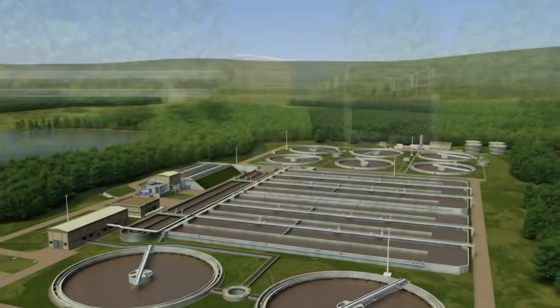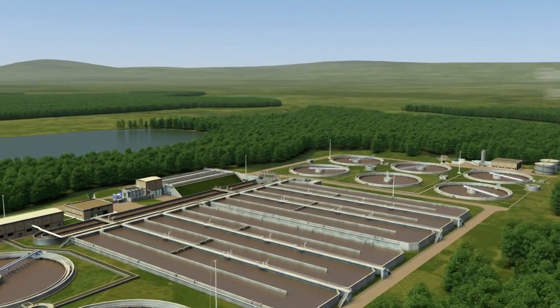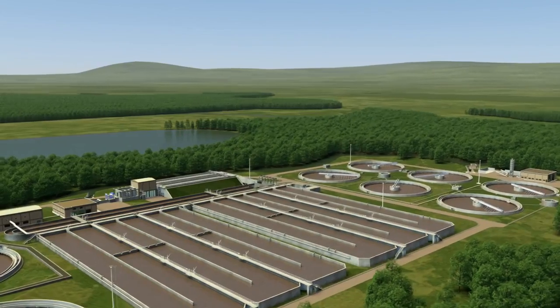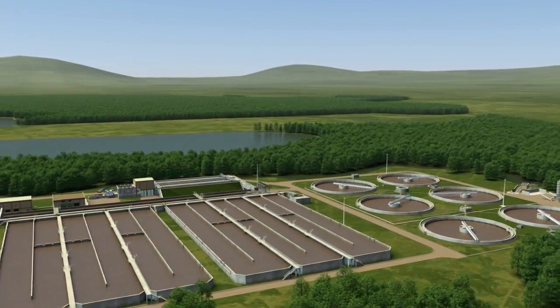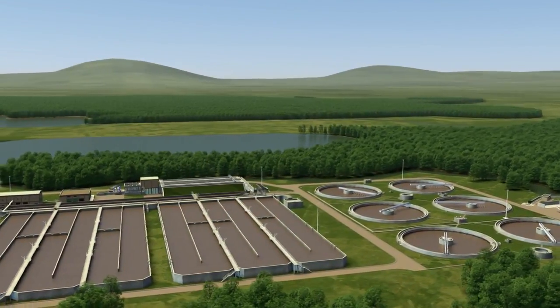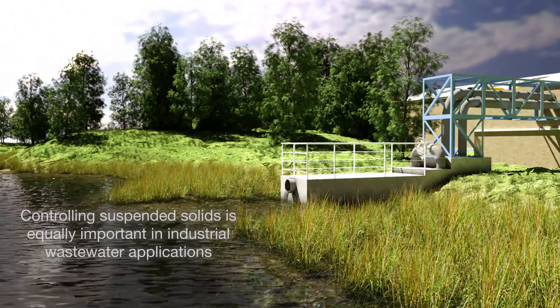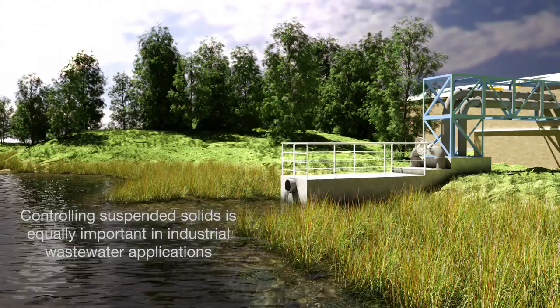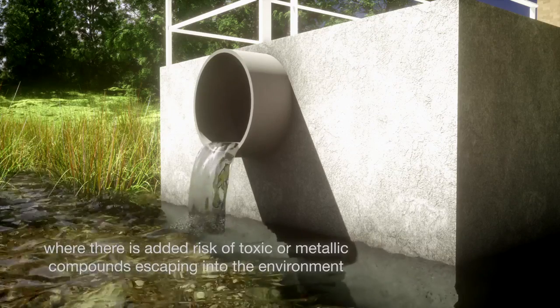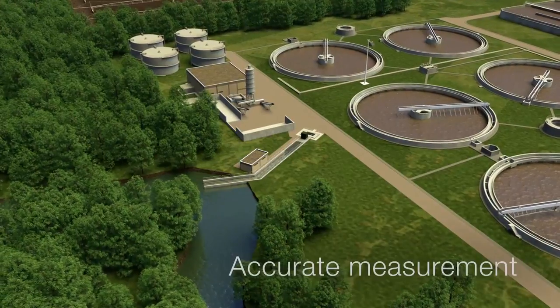Within the wastewater treatment plant itself, excess turbidity can be indicative of a poorly operating treatment process. It is important to address this issue as residual suspended solids breaking through from sewage digestion processes will continue to have a biological oxygen demand as they enter the receiving water. Controlling suspended solids is equally important in industrial wastewater applications, where there is the added risk of toxic or metallic compounds escaping into the environment.